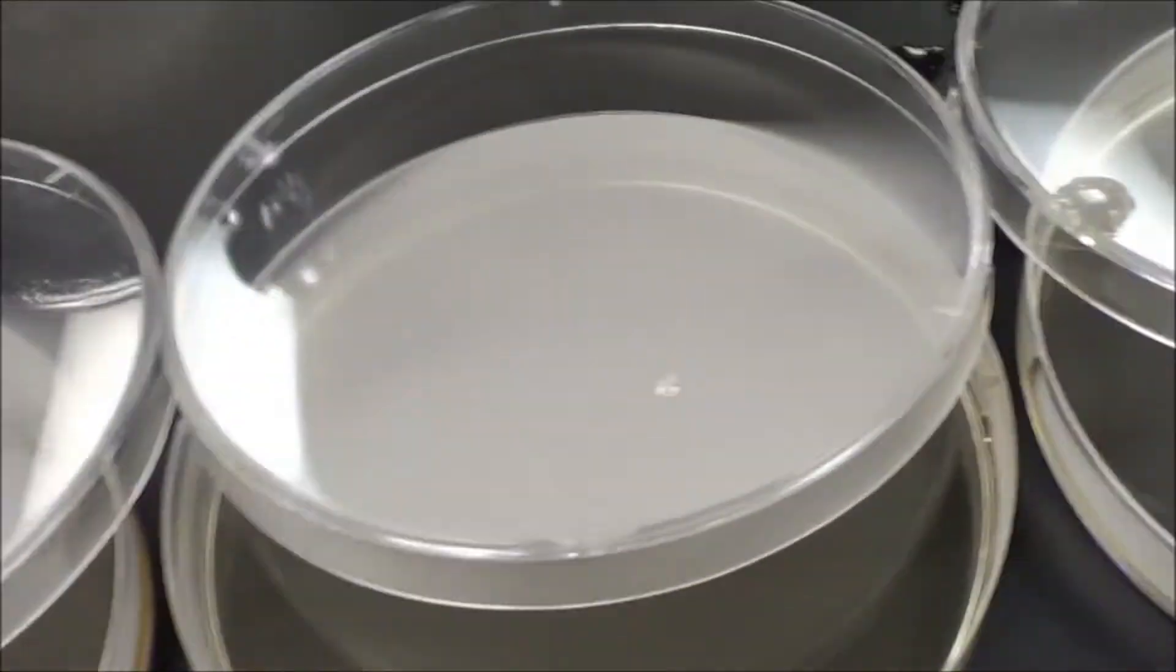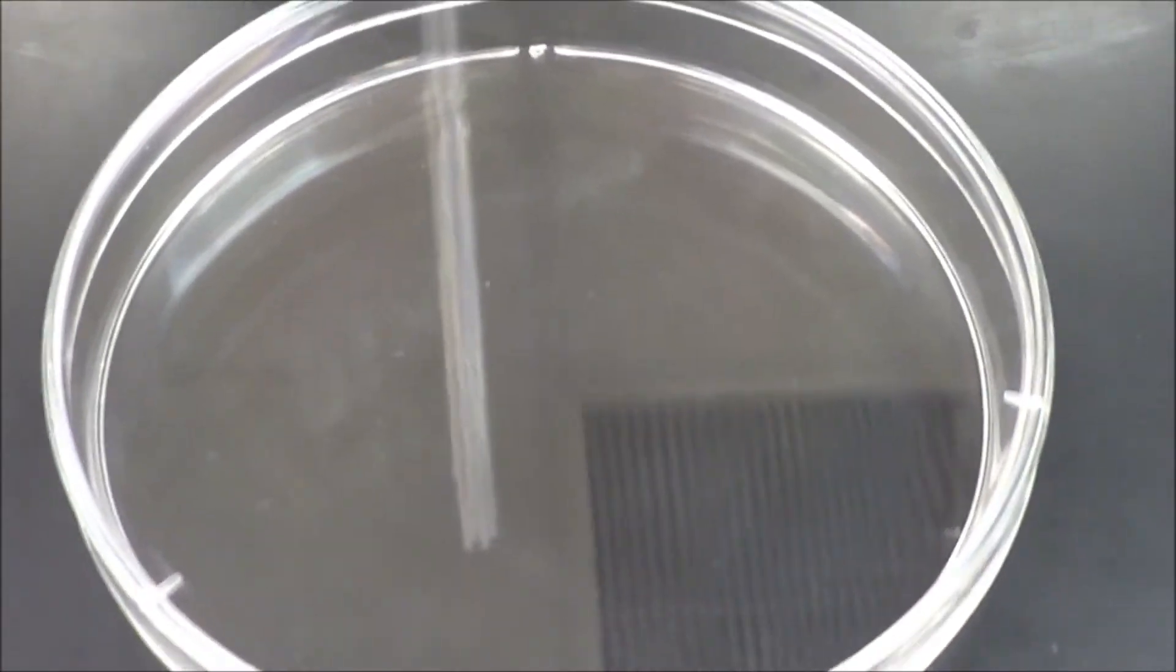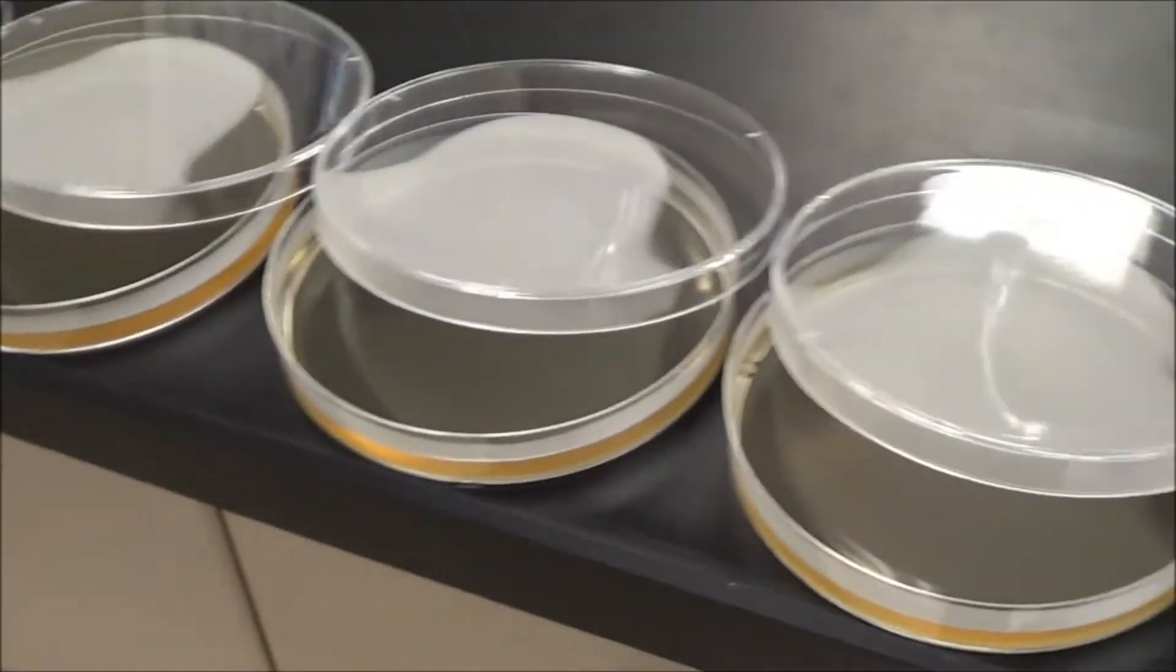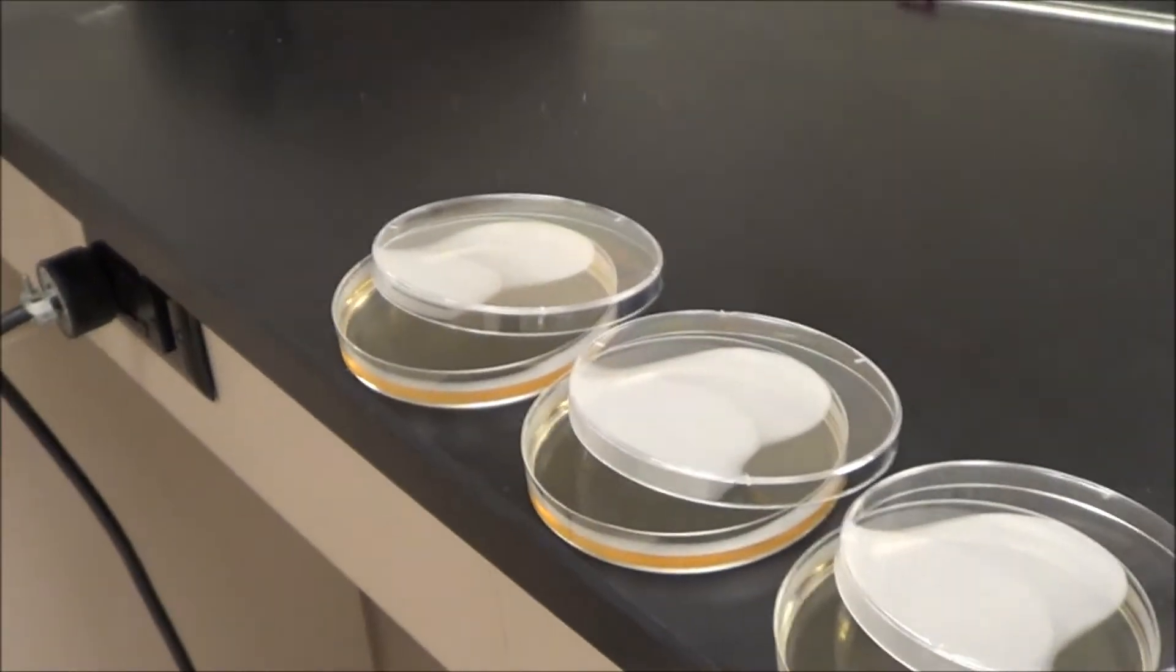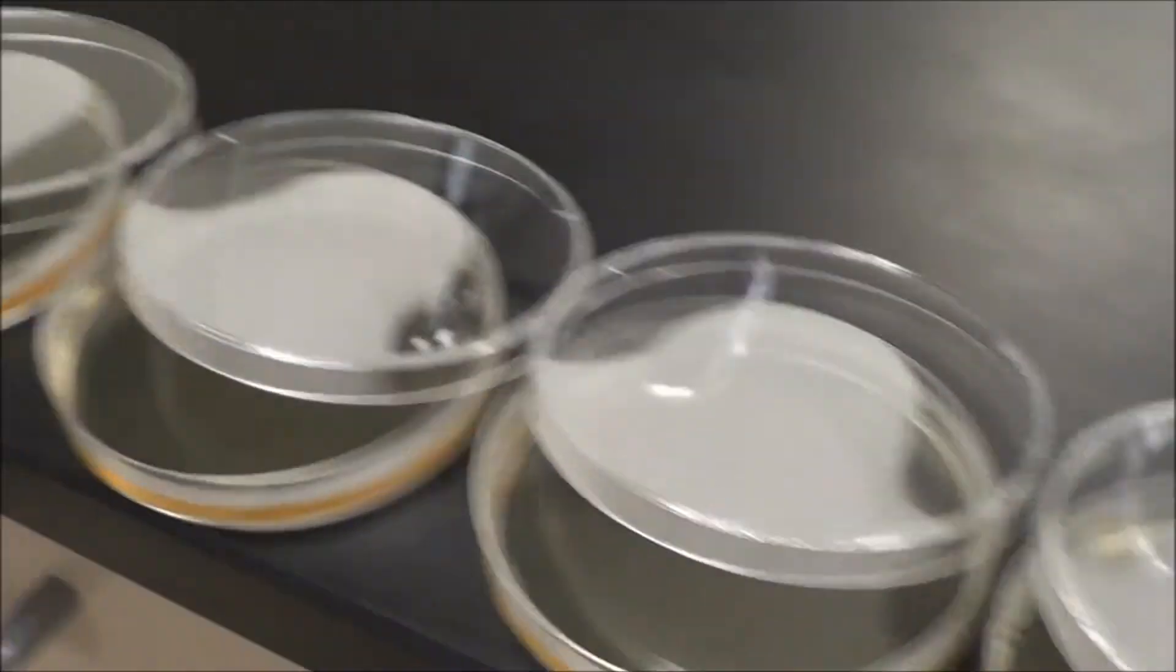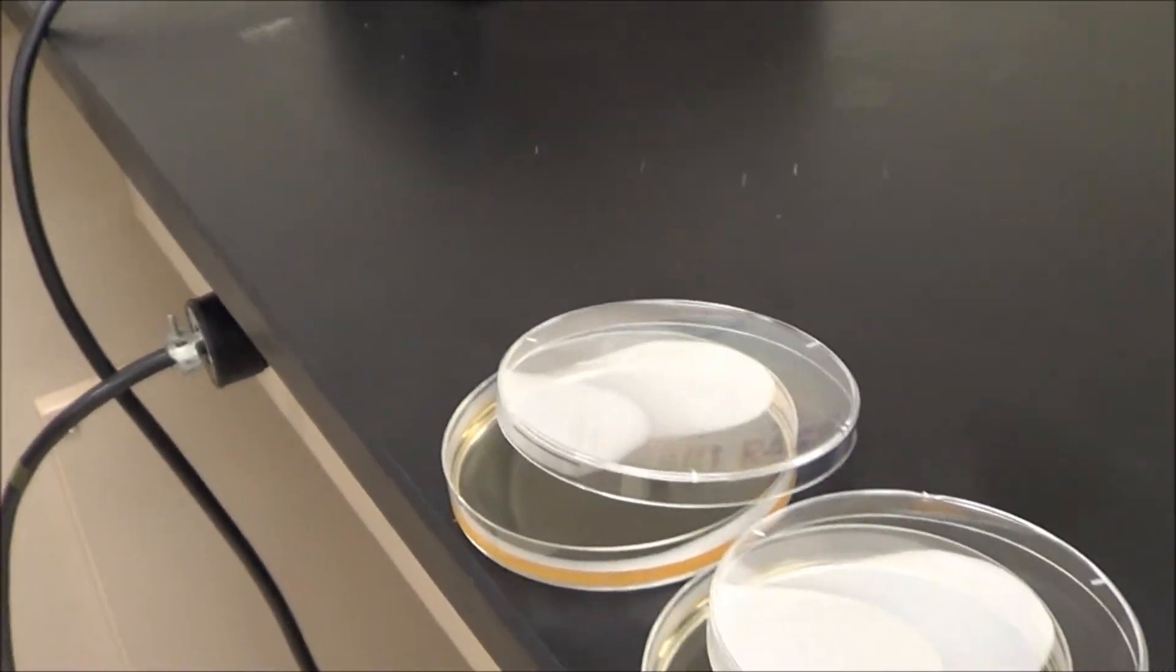I have 10 of them, and we didn't have enough for one though. But we're going to fix that in just a bit. So then, anyway, we are laying them cool here, and then we'll close them up, and I'll tell you what we have to do then.